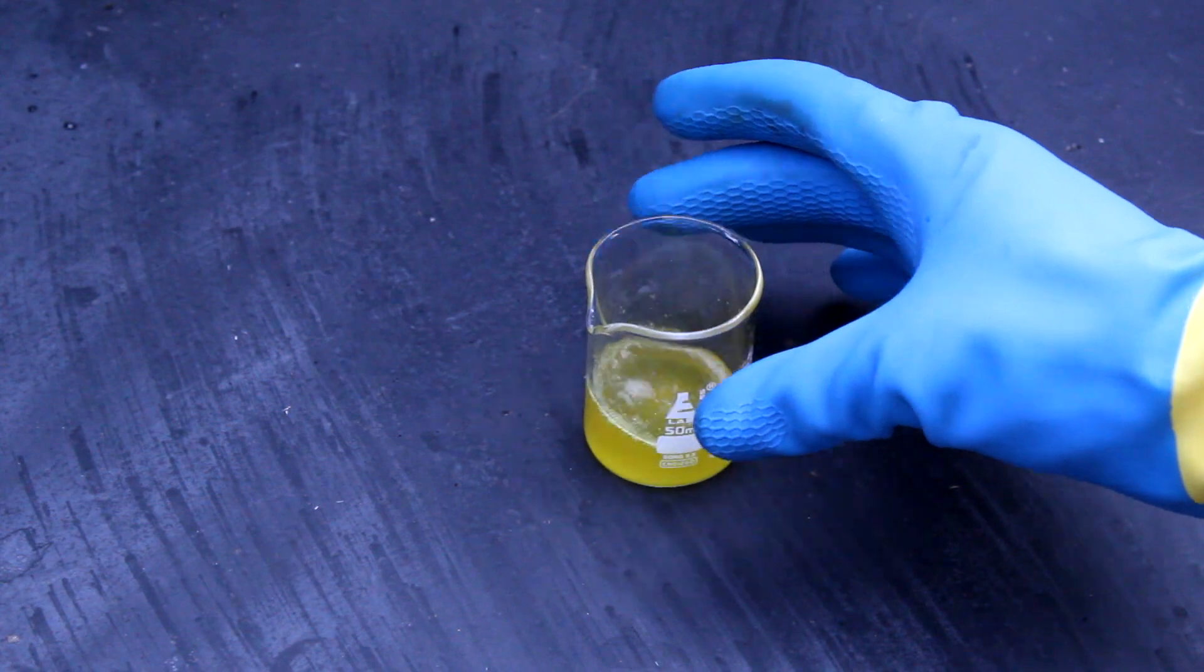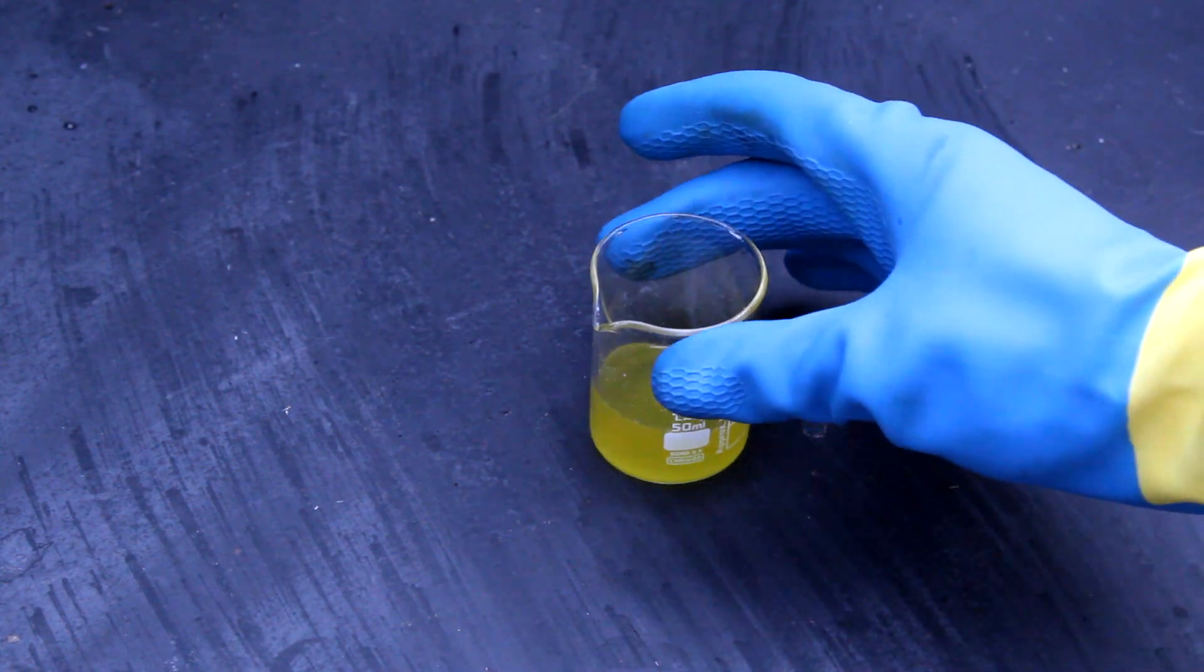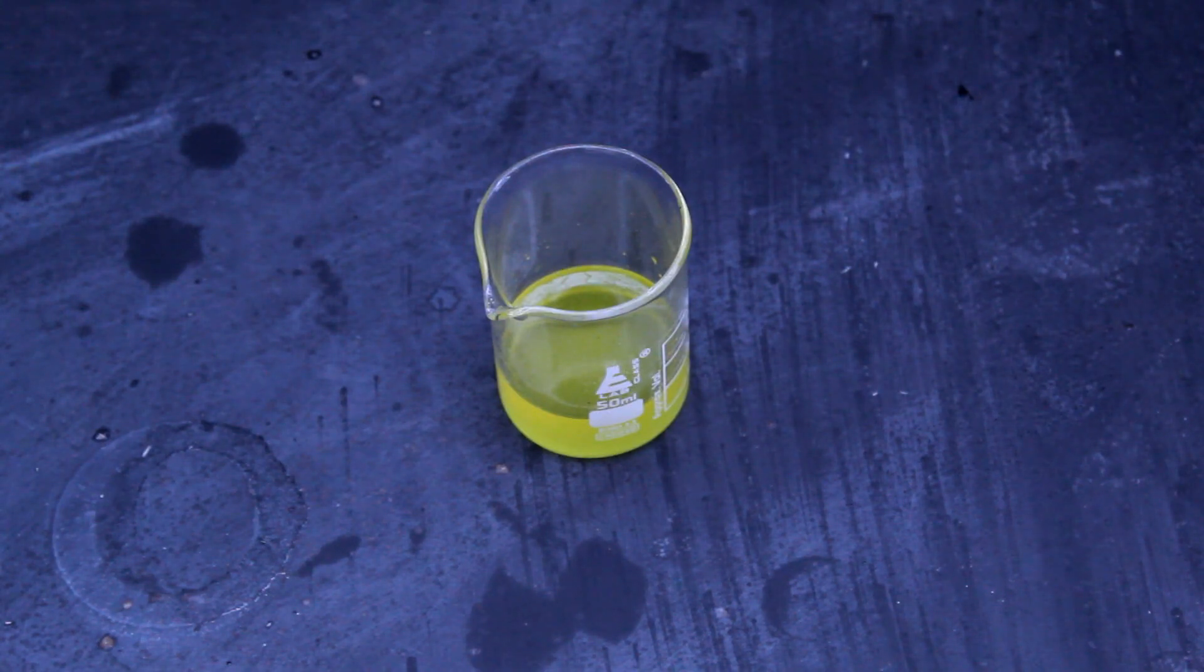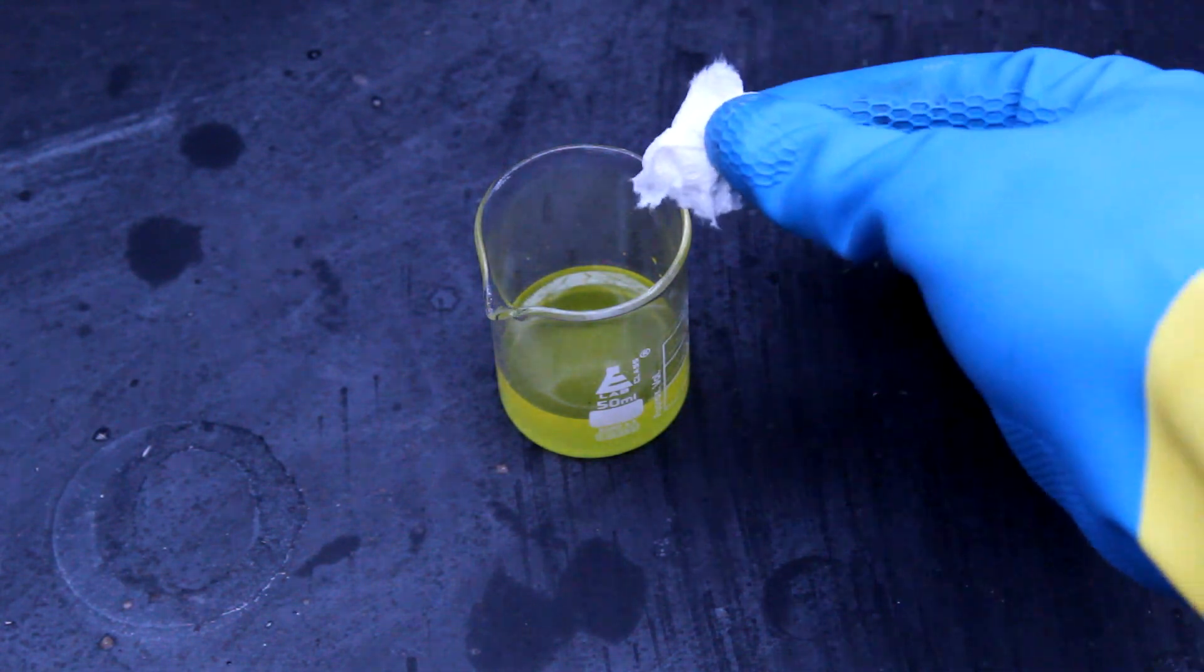Fortunately, the solution we have here is fairly dilute, and it's just handleable enough to try some experiments with. First off, let's check the acid's strength with a fairly standard unit of measure, the paper napkin.